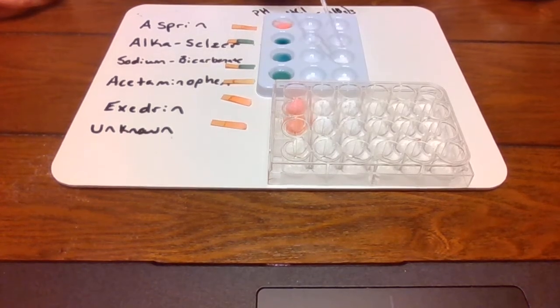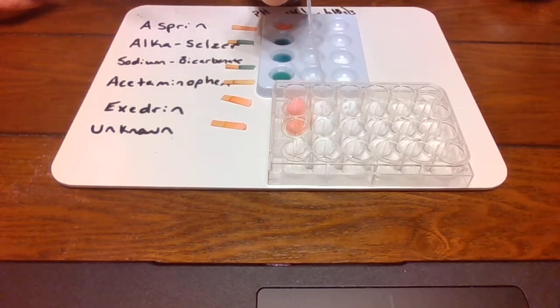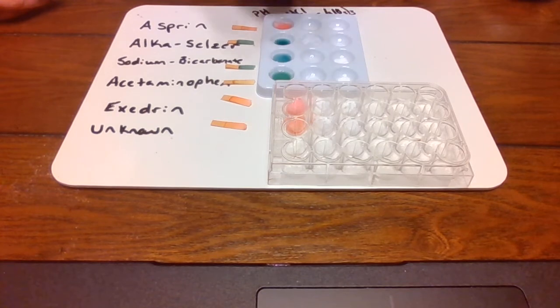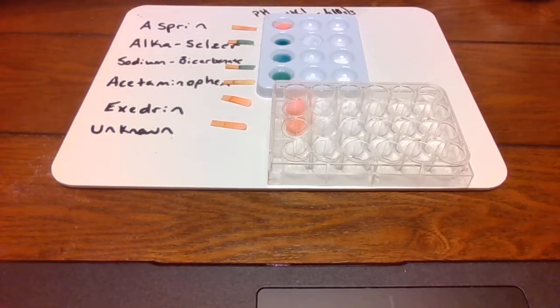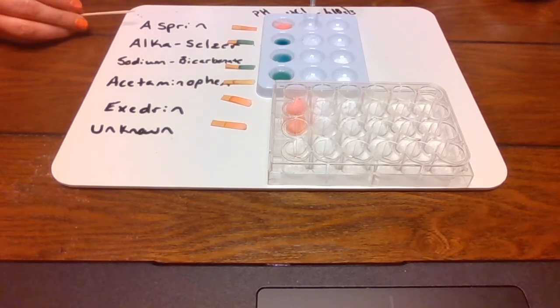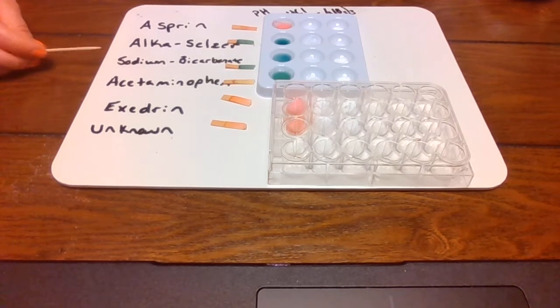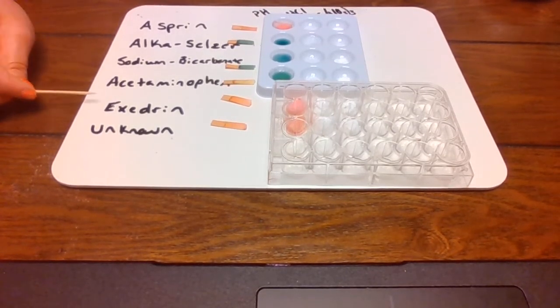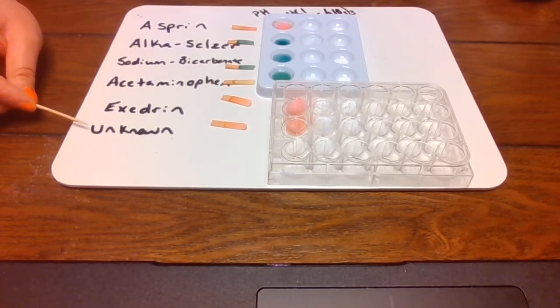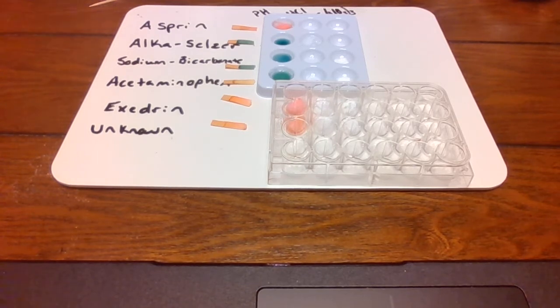Okay, not really much happening. I have these two right here. Nice. Don't touch it. Just put it in there. Next one. Okay. So guys, what I'm seeing is we have no reaction for aspirin. It fizzes for Alka-Seltzer. It fizzes for the sodium bicarbonate. And then we have no reaction for the next three. Acetaminophen, Excedrin, and the unknown. No reaction. No fizzing. No dissolving. It's just kind of sitting on top of it.